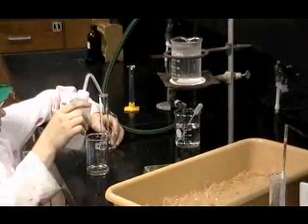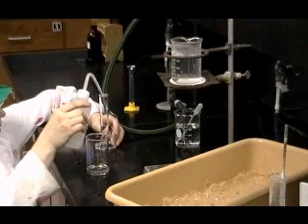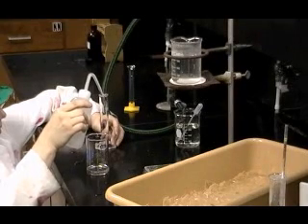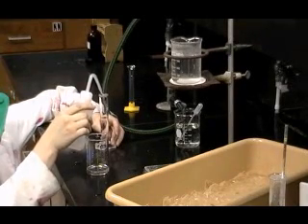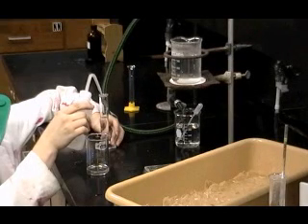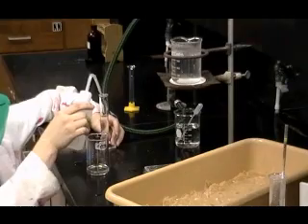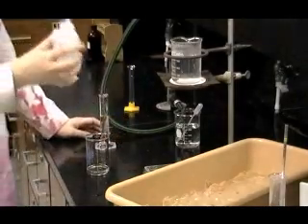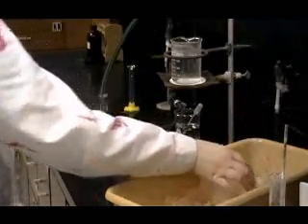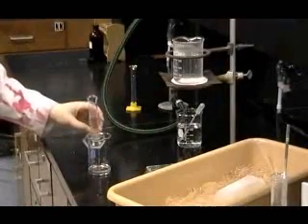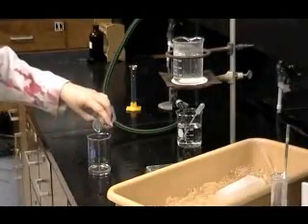Step 6 begins by measuring 20 milliliters of ice-cold deionized water in a graduated cylinder and adding it to the 150 milliliter beaker containing the aspirin sample. Stir and then pack the beaker in ice to allow the aspirin to crystallize. The cold temperature drives the formation of crystals. Remember to keep your plastic wash bottle packed in ice when not in use.